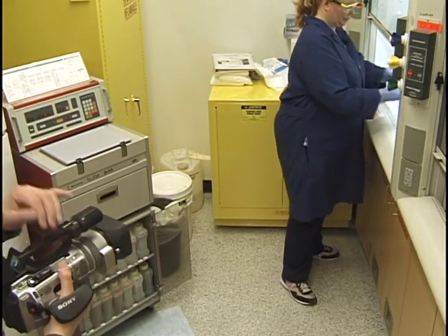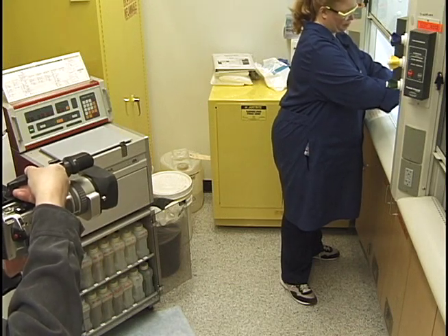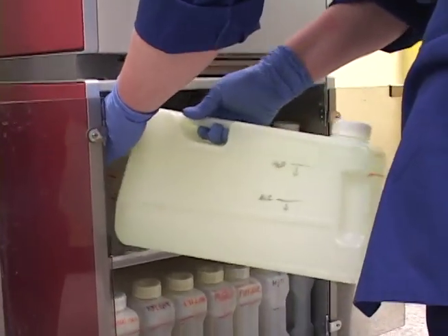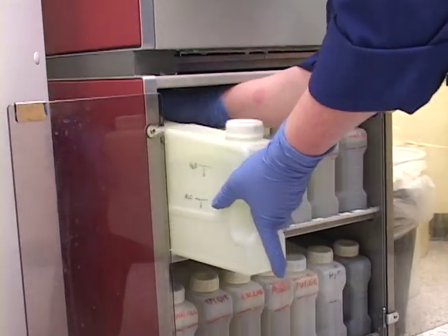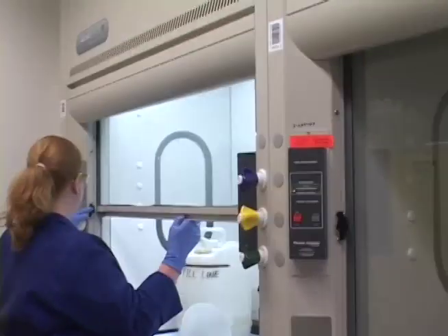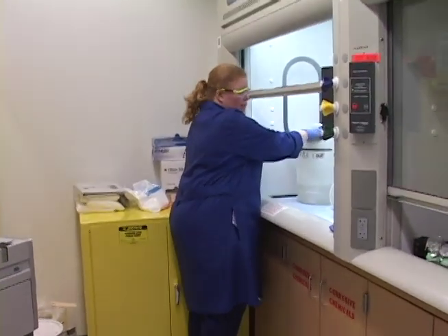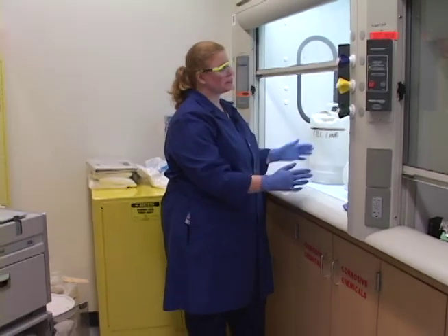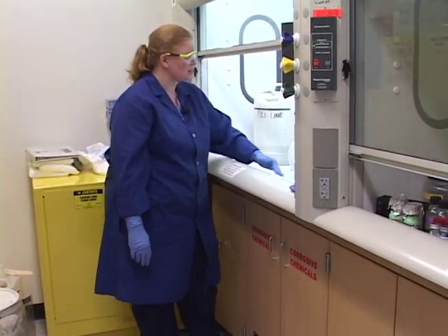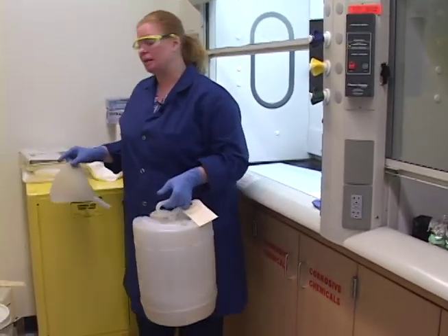I don't always change the formalin quite as frequently, but at every full change I would encourage you to rotate the reagents and about once a month do a complete full change of the processor, depending upon how much it's used. If you didn't want to change the whole processor but wanted to be sure your tissue is processed nicely, the most critical things to change are the xylenes and the 100% alcohols. If it's a little overfull, I might take a container and dump some of that extra formalin into a container to be used for fixing tissue later — so I'll get rid of just a little bit and somebody can use that.